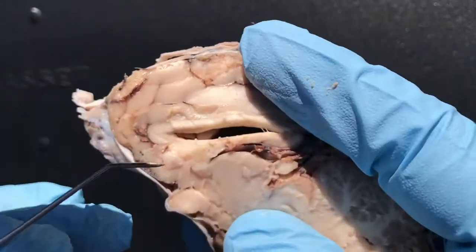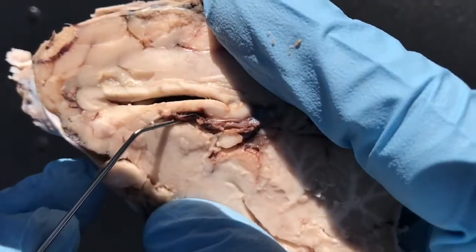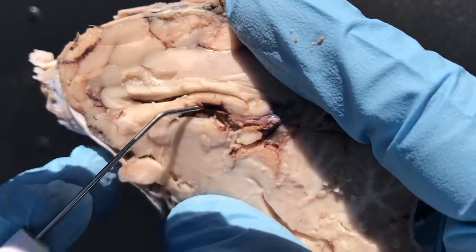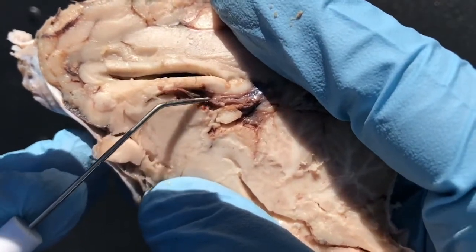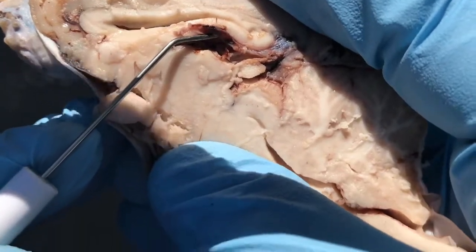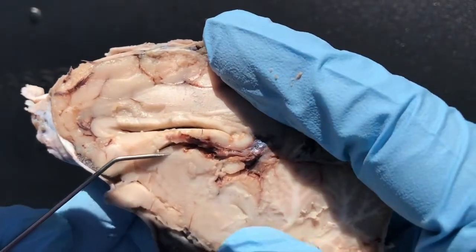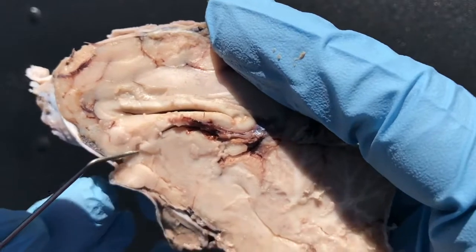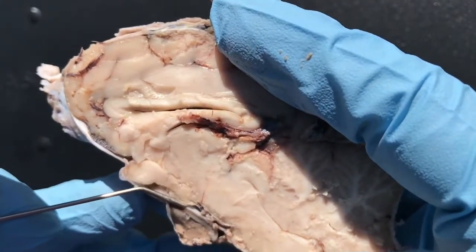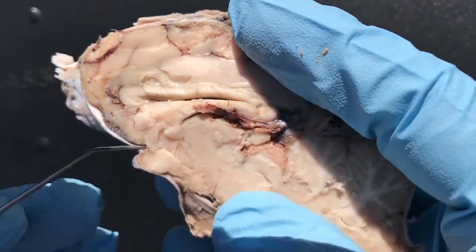If we move below the fornix now, this is the choroid plexus. All these little blood vessels here — this is the choroid plexus right here. And that means that this here is the thalamus. And the hypothalamus then is all this here. Thalamus and hypothalamus.